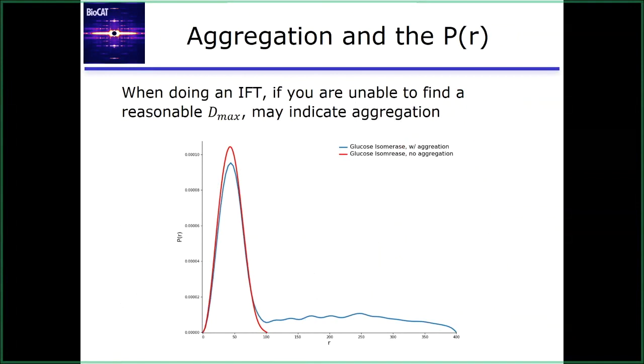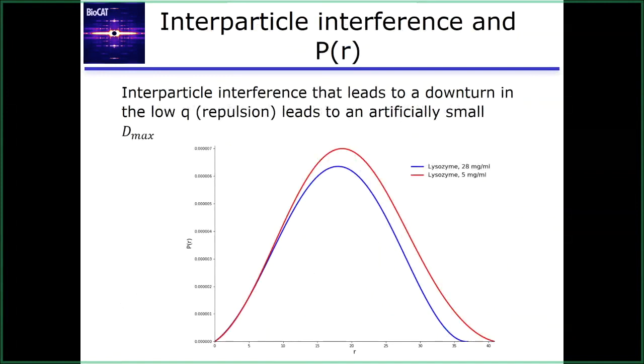You could probably keep extending this out essentially to infinity, as good as our data is, and not ever see something that's going naturally to 0. So it's very sensitive to these kind of aggregates in solution. You can see a similar effect, but less dramatic, with flexibility. You'll get something where there's a lot of stuff really close to 0, and then eventually it goes to 0, because there's a wide range out there where it's kind of flopping around, and there's a few things in your ensemble that have really extended conformations that you're sampling. So this is a very telling sign of aggregation. Usually it ends up meaning there's no good way to pick a Dmax. So you have to be careful with that. And it's a good analysis technique.